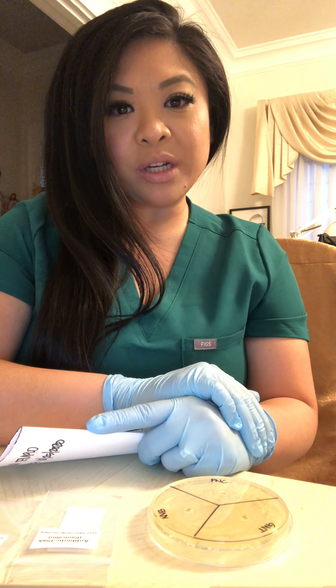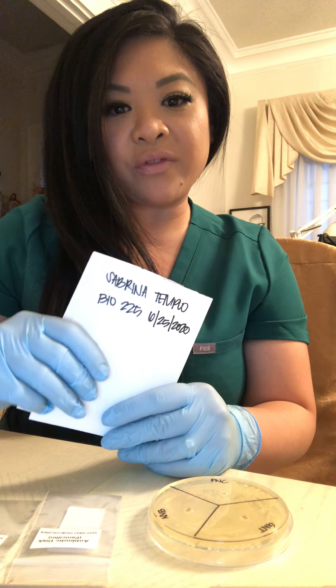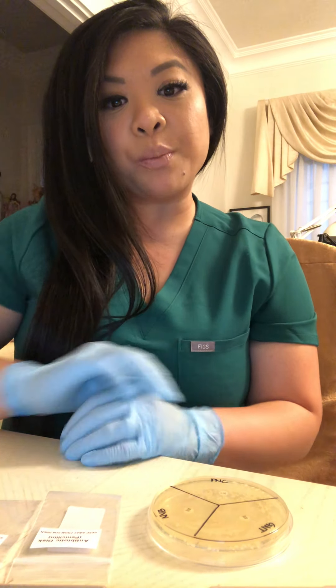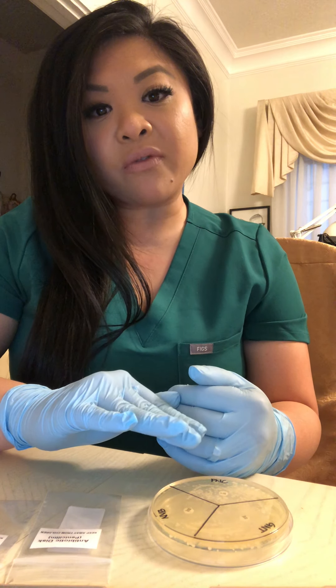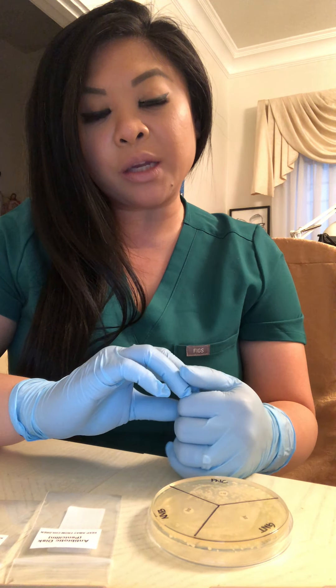Hello, my name is Sabrina Templo. Today is June 25, 2020, and this video is for Bio 225, Week 7 for the Antibiotic Sensitivity.